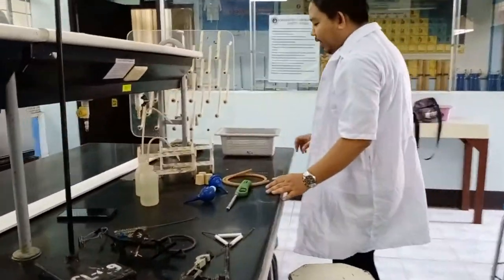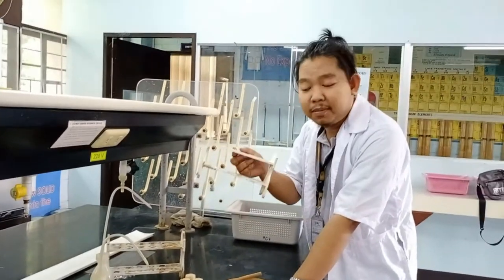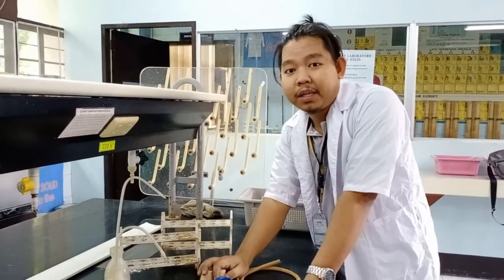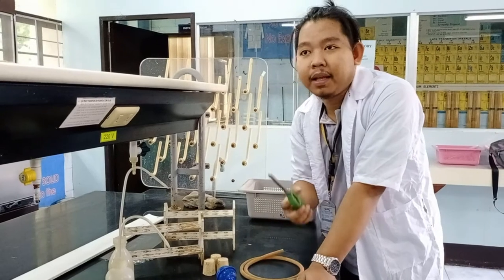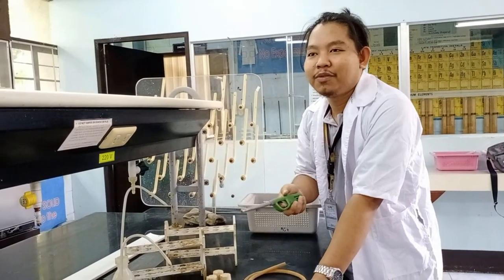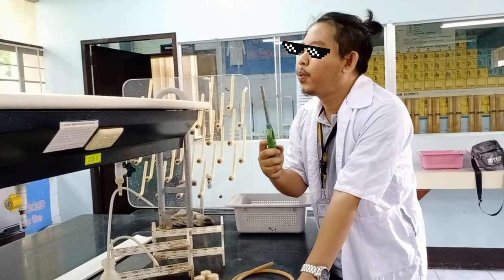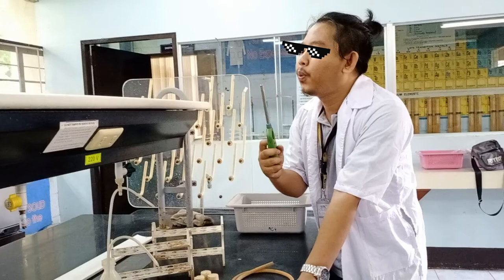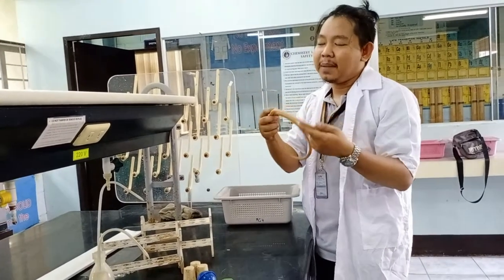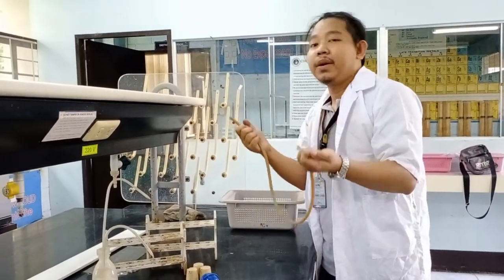And here we have some accessories to aid us in preparing our laboratory. We have the test tube brush. We have the cork stopper — sometimes we also have rubber stoppers, depending on the test tube and the condenser size being used. We also have this lighter or igniter. And we have the glass tube and rubber tube — sometimes you also use a glass tube — which we use for gas connections in Bunsen burner setups.